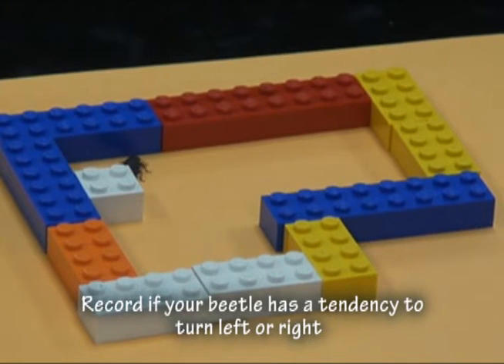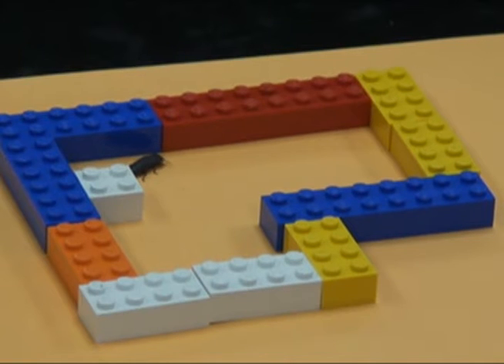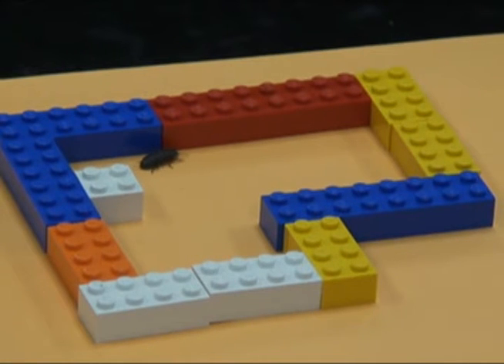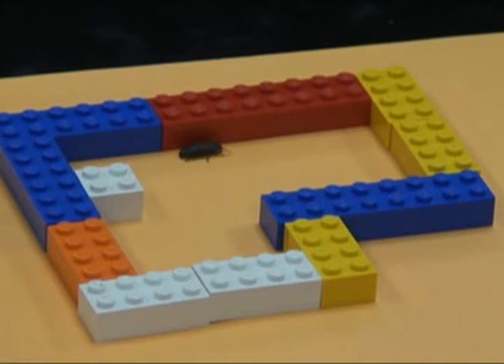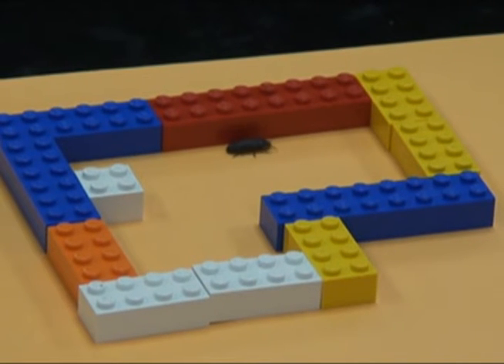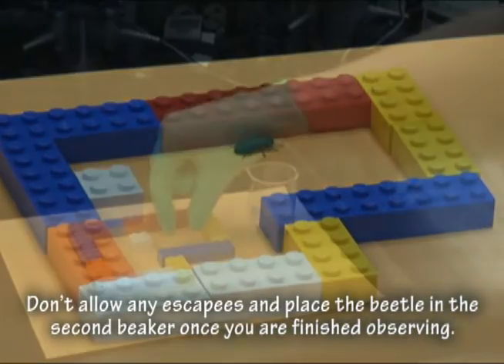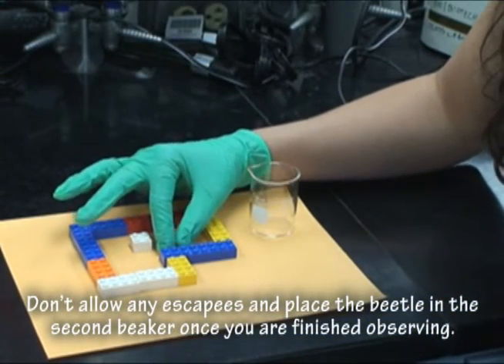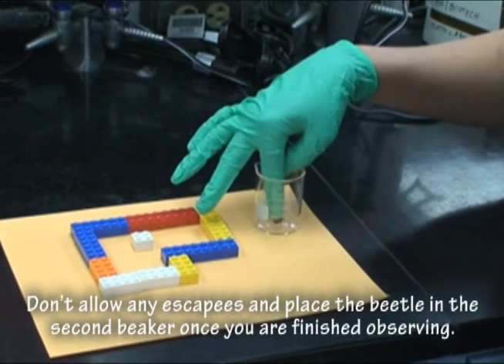Record if your beetle has a tendency to turn left or right. Don't allow any escapees, and place the beetle in the second beaker once you are finished observing.